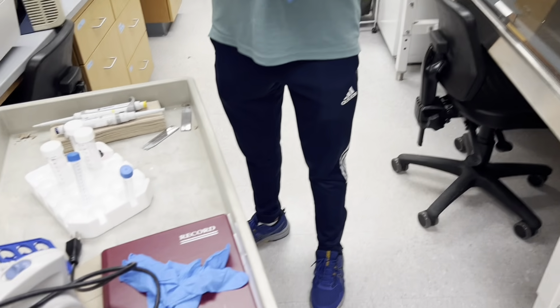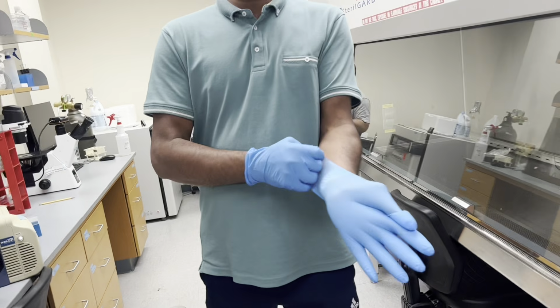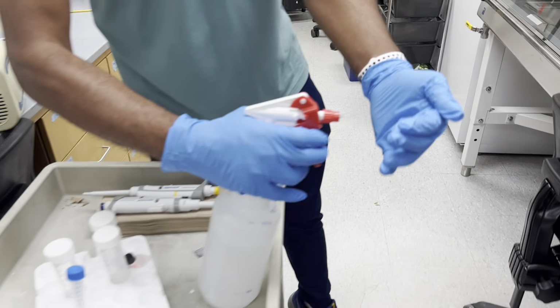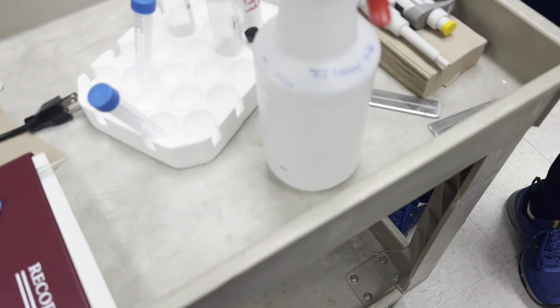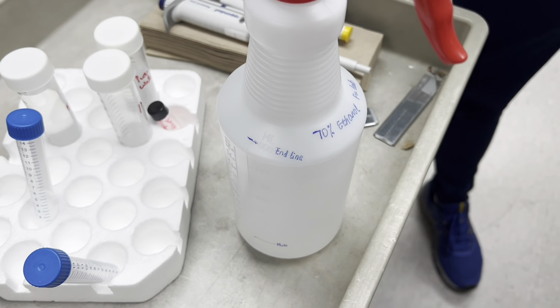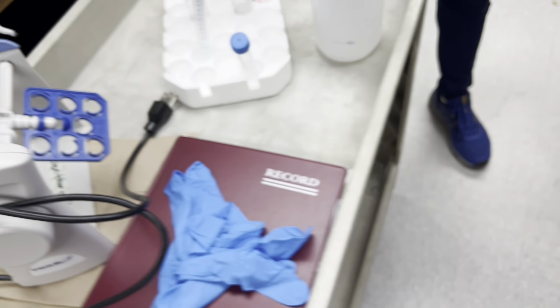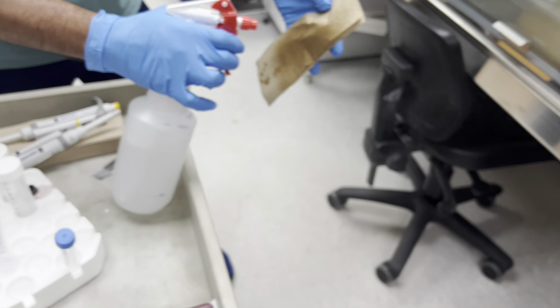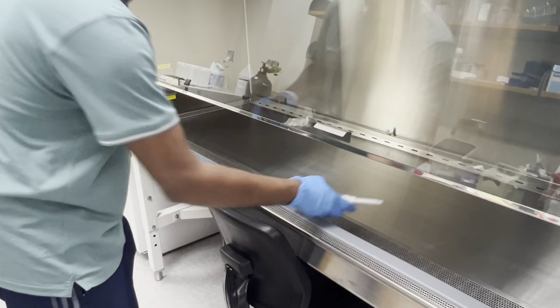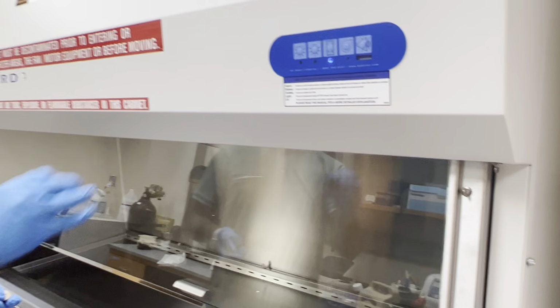This is to avoid contamination from bacteria or anything else. Before using, take some 70% ethanol on your gloves. The rest of it will be water. Oh, they marked the water for you. Cool. Take these, do the usual. And then open this one, insert it, turn on the light.